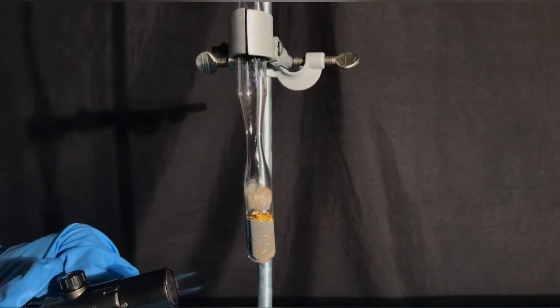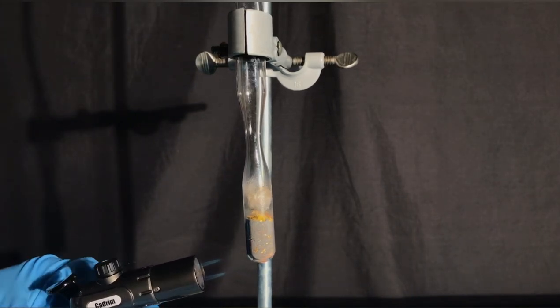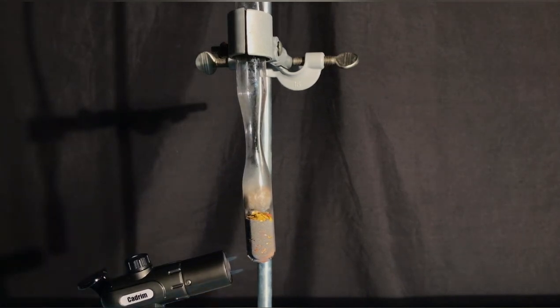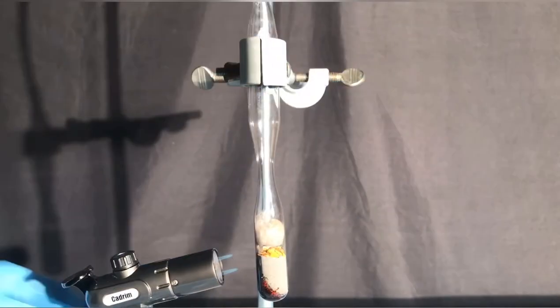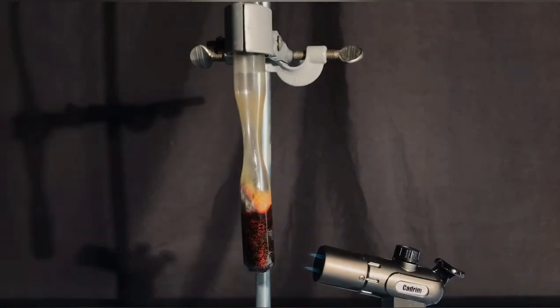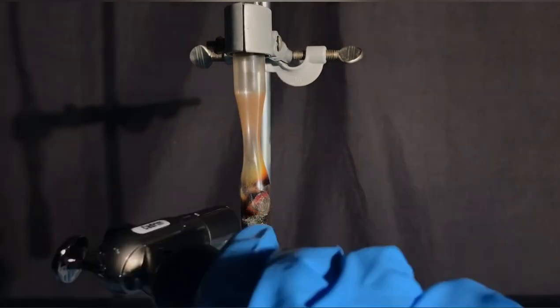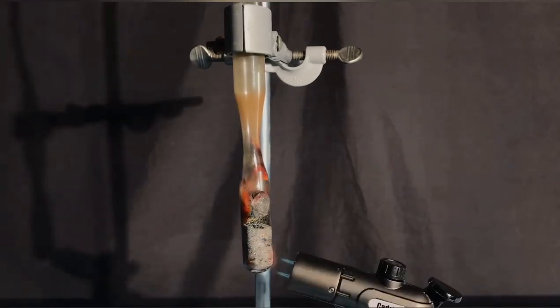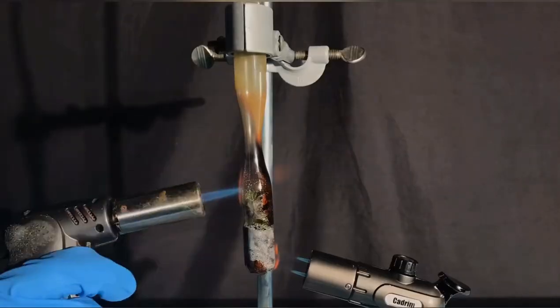I was a little too hungry and stretched out the neck too long and it broke. Therefore, I added a makeshift filter made from a syringe filled with cotton and attached it to the test tube. I was hoping that we were able to completely seal the ampoule this way. The arsenic would be produced, it would resublimate in the middle part and afterwards we could just ampoule it. We would have stretched out the bottom part in order to create an ampoule from the middle part. Because we fucked up though, we had to improvise and do it another way.